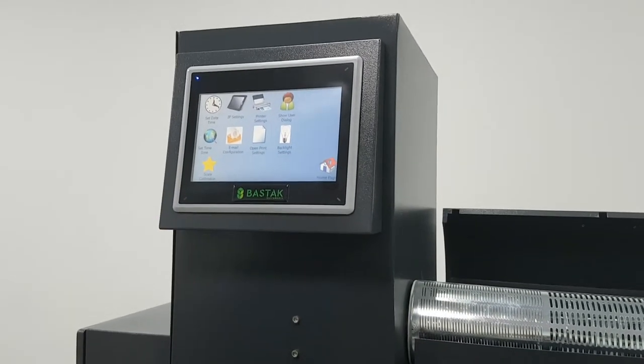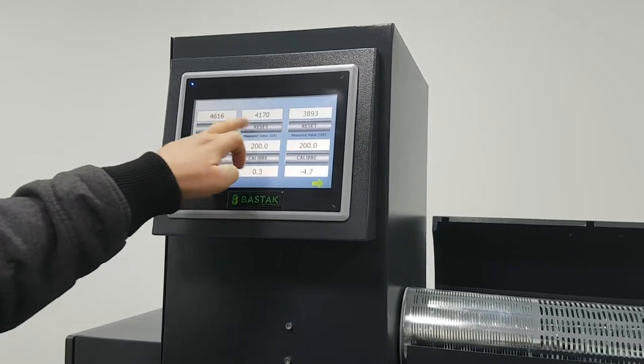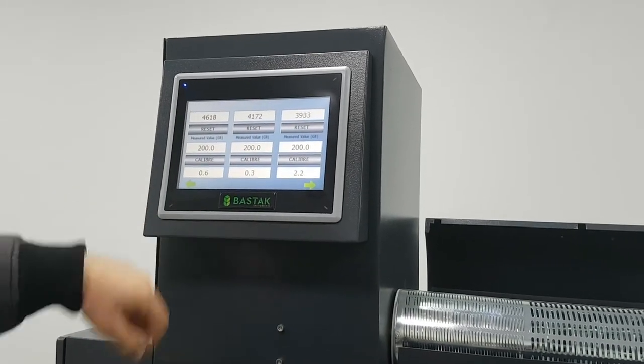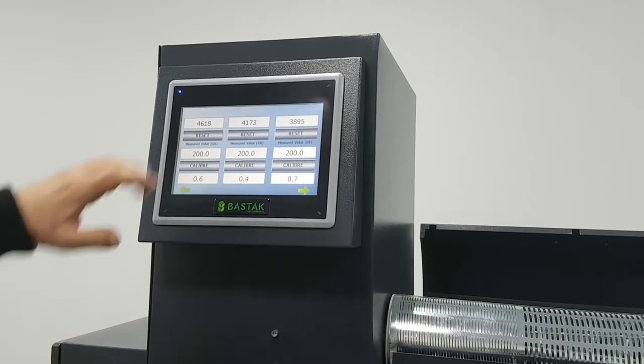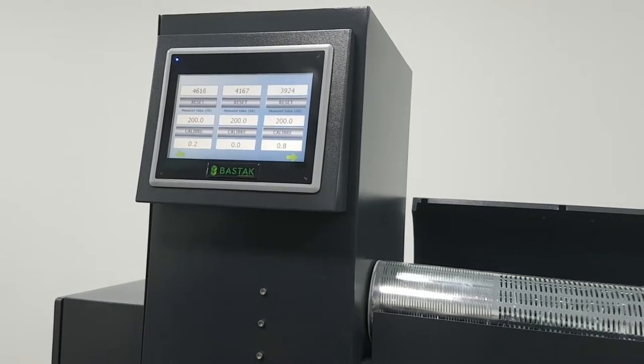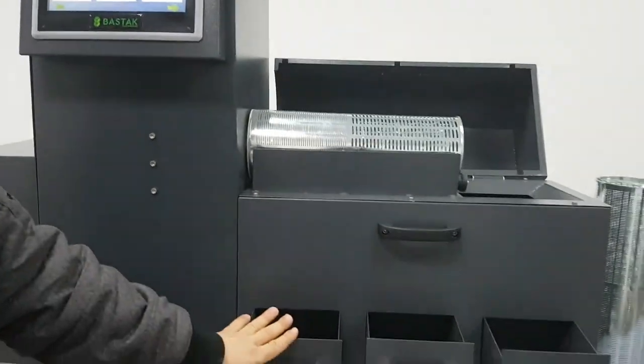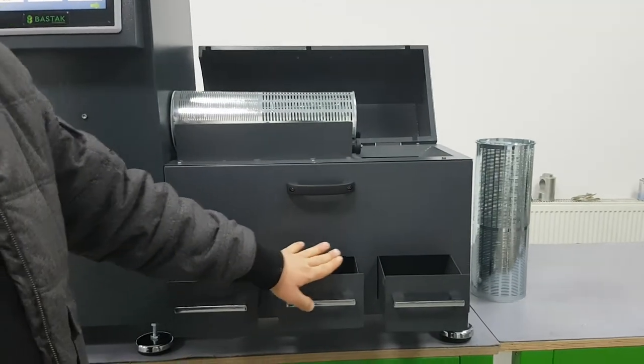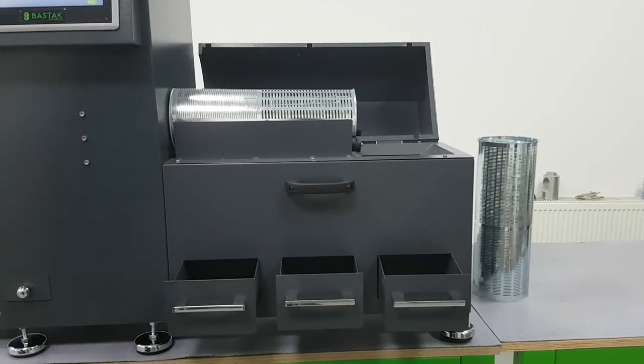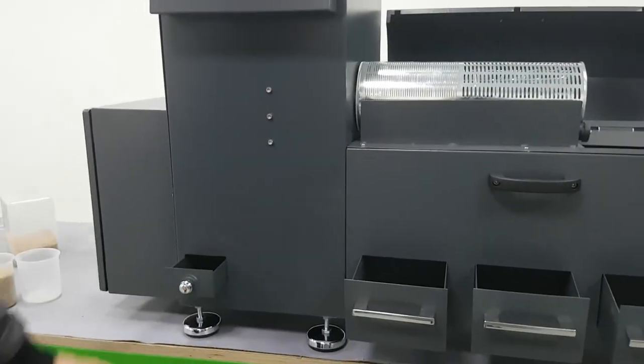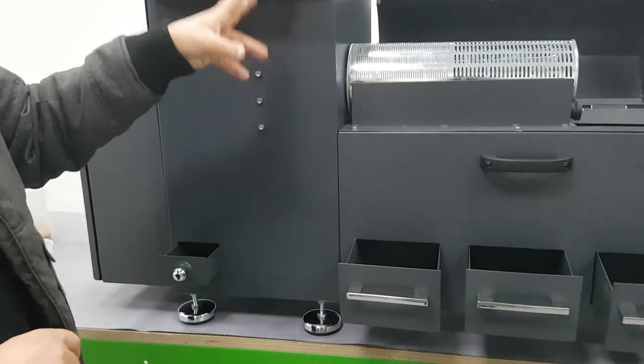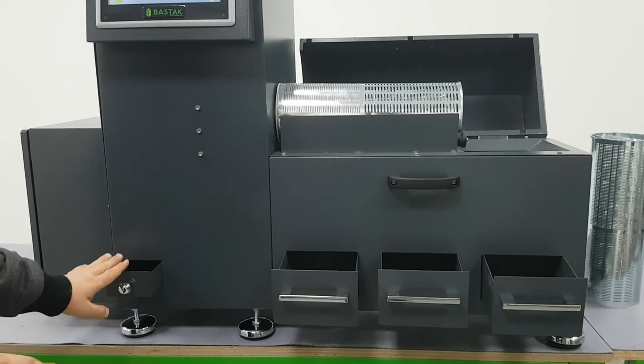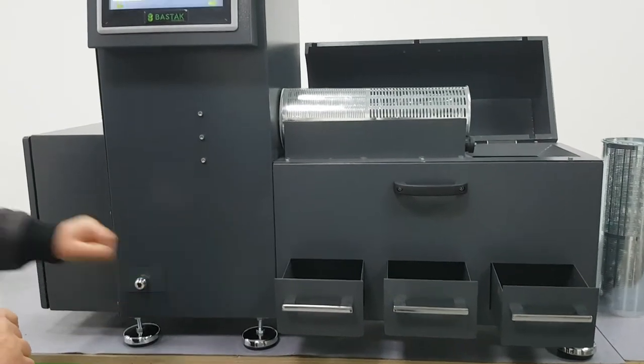Scale calibration. We can make receipts for each scale. We have four scales in the machine. First scale is on the top for the sample. Second scale is for the broken materials. Third for good materials. Fourth for the foreign materials. For light materials, we don't have a scale. The difference between the total sample and the rest is light materials.